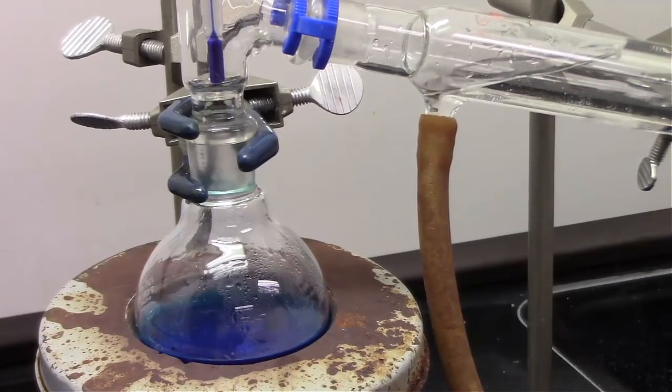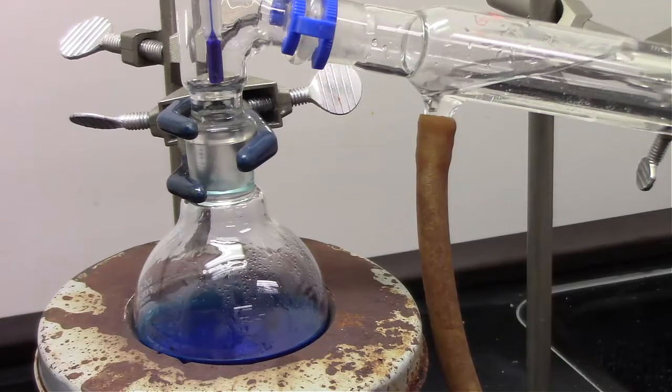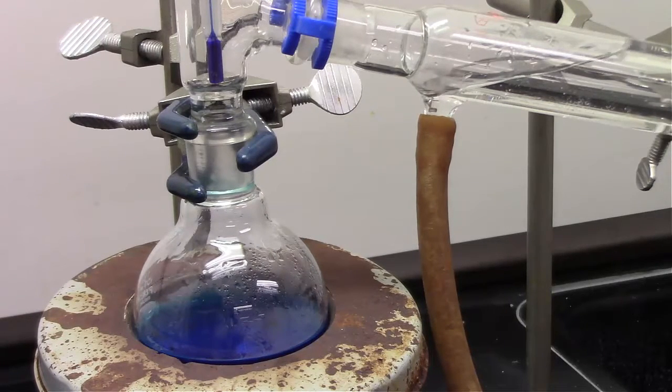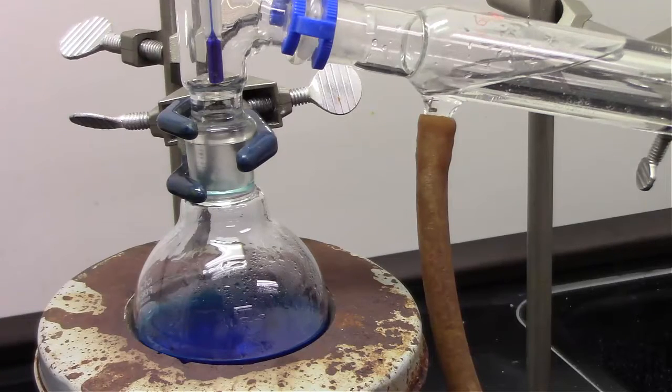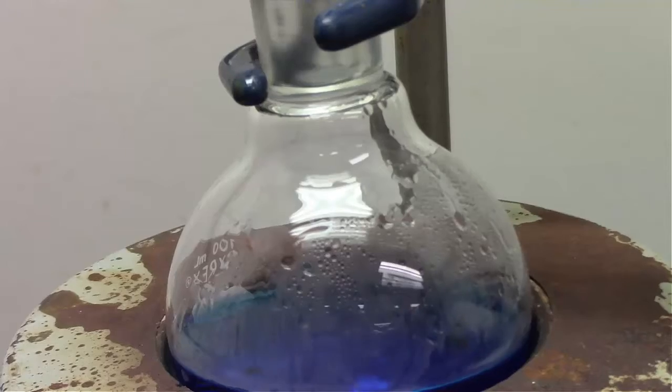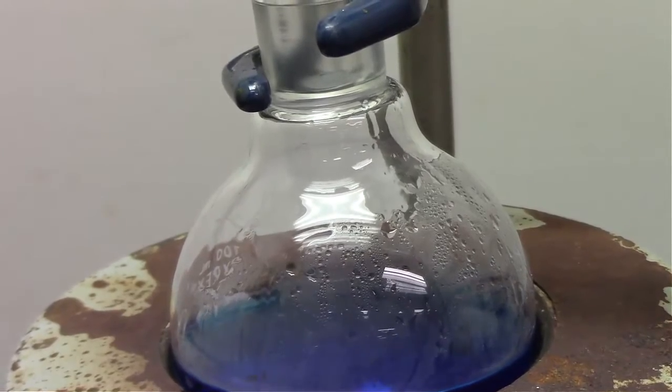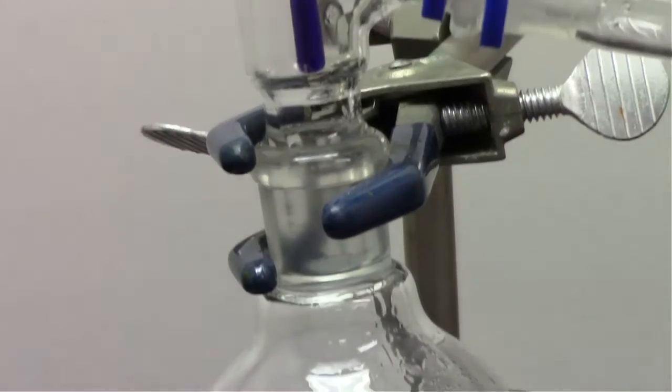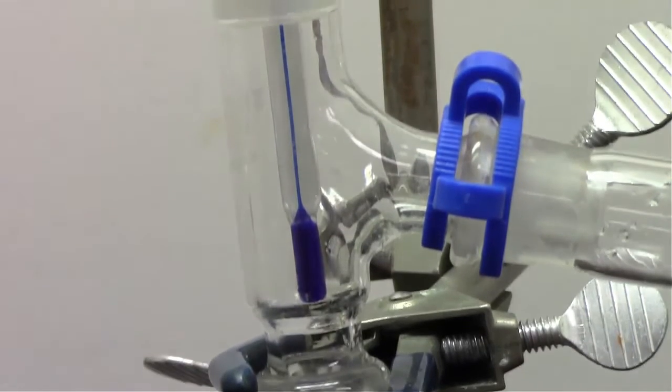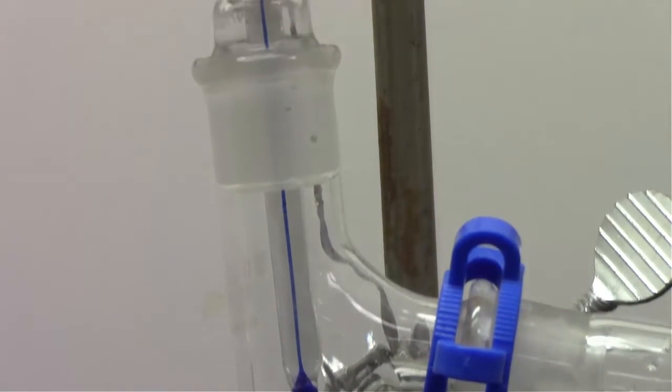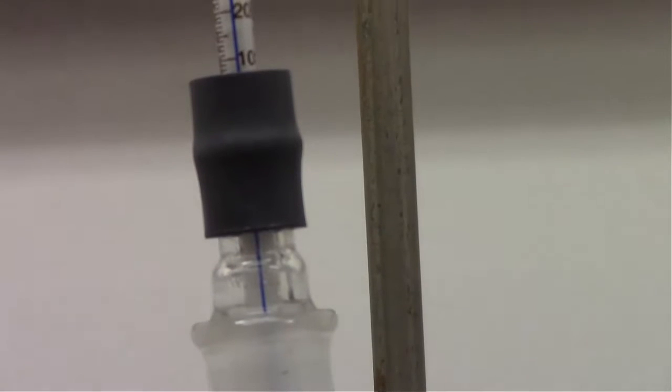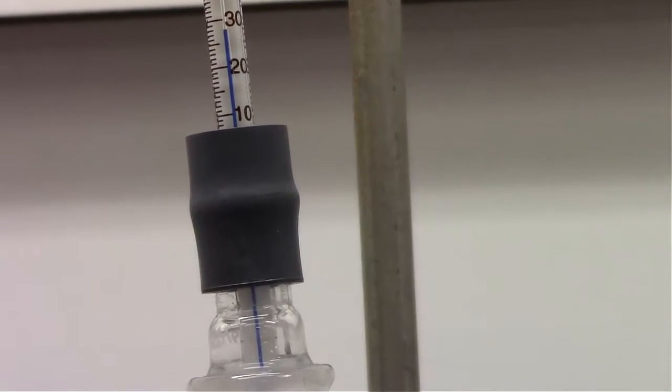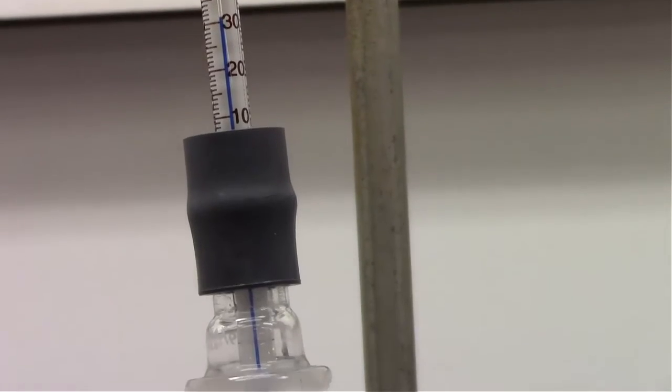At this point, we can start to see some evaporation and condensation. I say we can see evaporation. I can't actually see the evaporation, but I can see the condensation on the round-bottom flask. So essentially after the liquid evaporates, and acetone has the lower boiling point, so that is what is evaporating, and then condensing on the cooler glass area. We need to heat it to the point where we're essentially at the point of the three-way adapter, so that can actually go to the condenser.